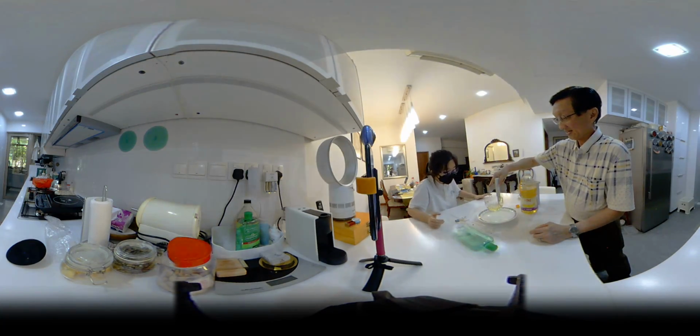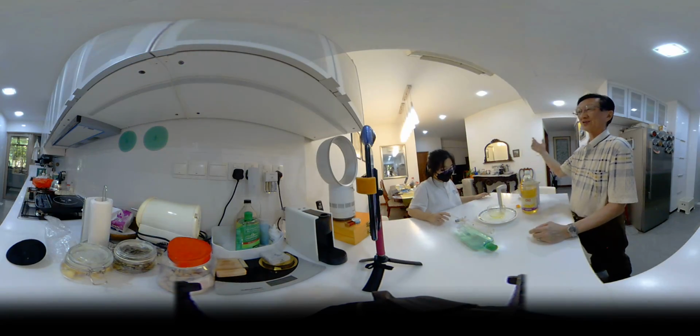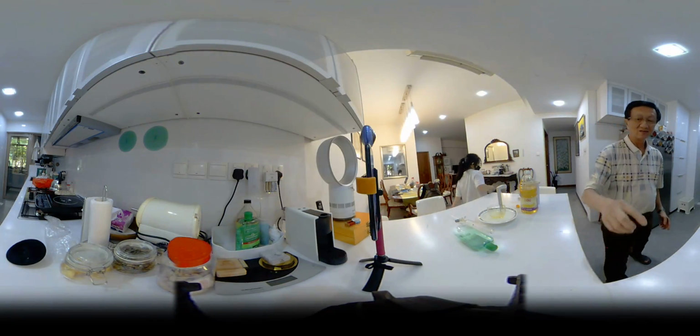And this is a little bit oily. Go and wash your hands. Go and wash your hands.